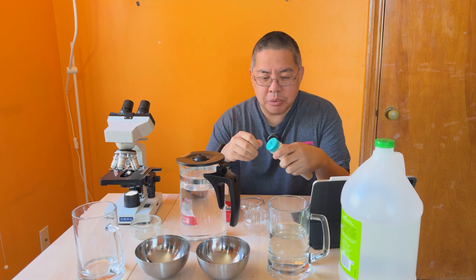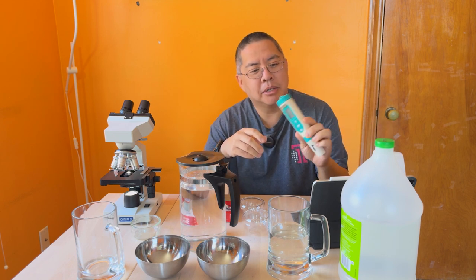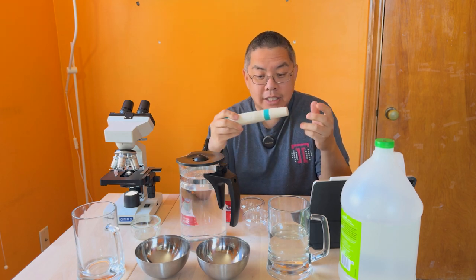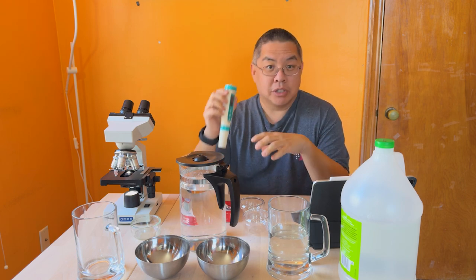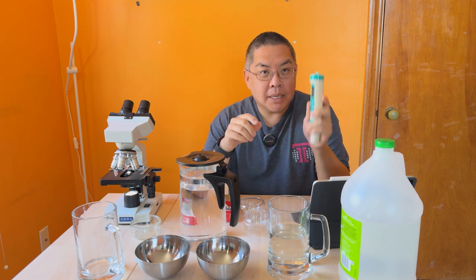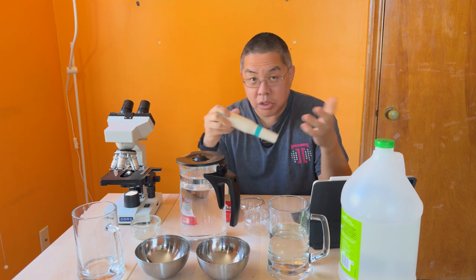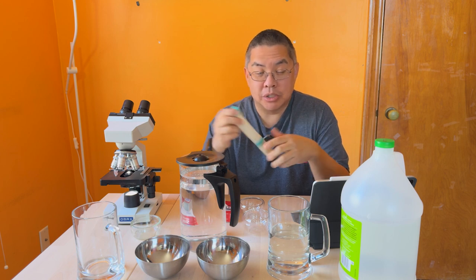There are plenty of devices you can get on Amazon. I've got one here — it's a seven-in-one tester. The way we do water quality testing is to take a water sample and a reference sample and compare the numbers. A big part of using all these tools is calibration. That's one of the first things you have to do: calibrate the tool to make sure it's working and giving you real numbers. If you don't do that, you may be reporting completely incorrect things.